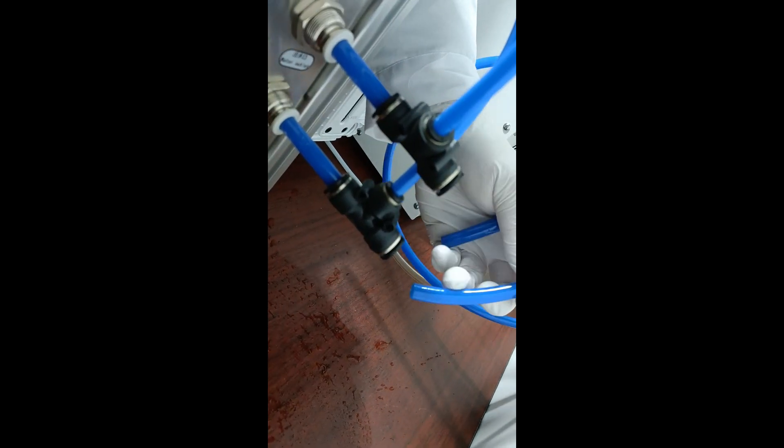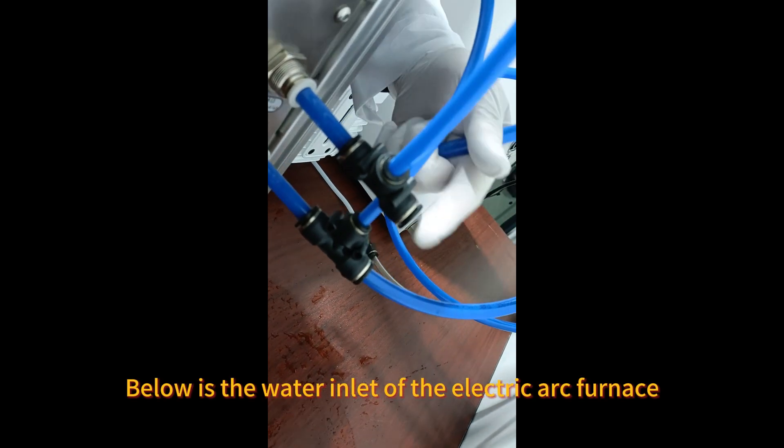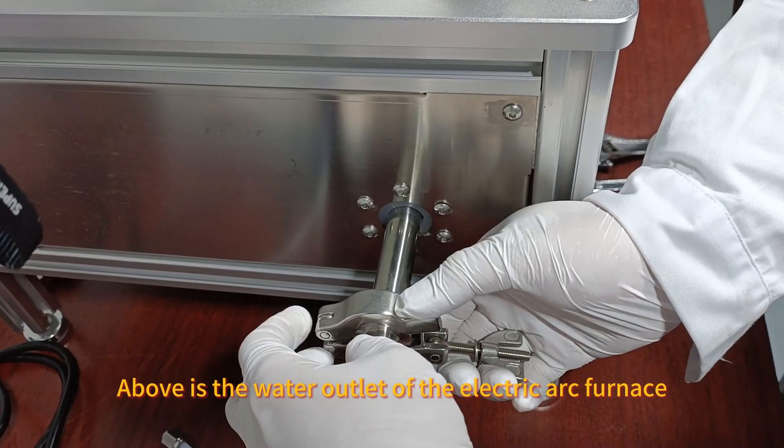Electric arc furnace installation operation. Below is the water inlet of the electric arc furnace. Above is the water outlet of the electric arc furnace.